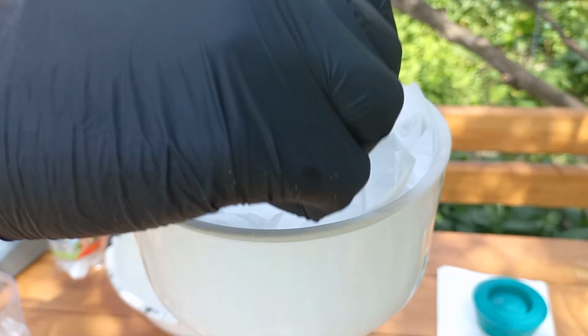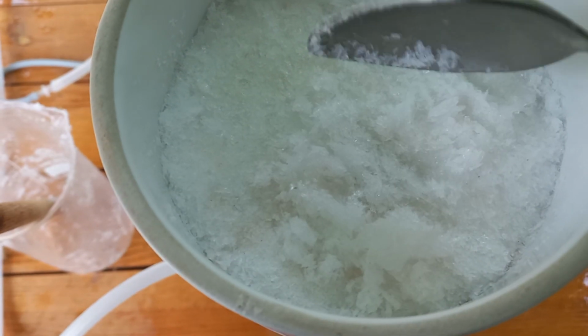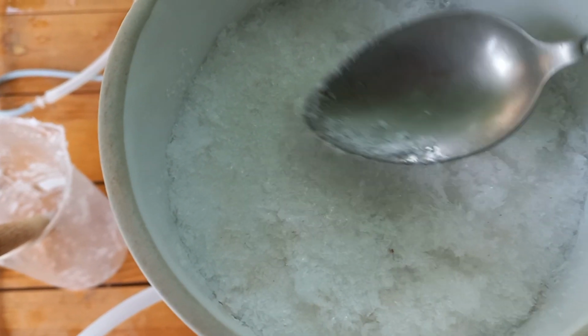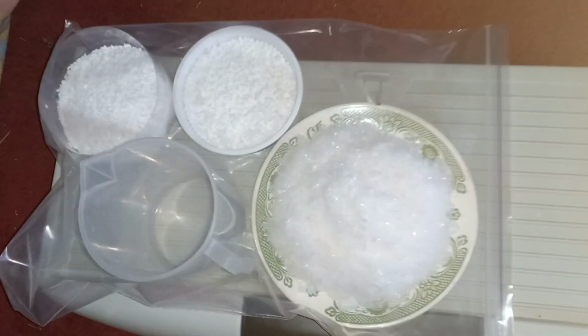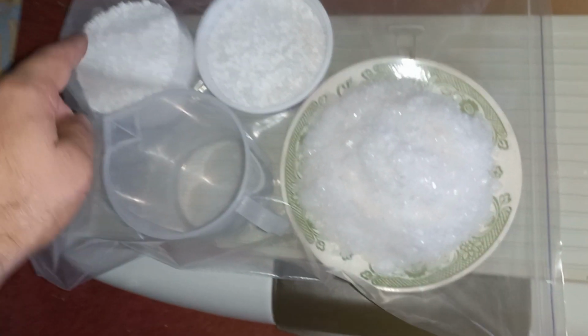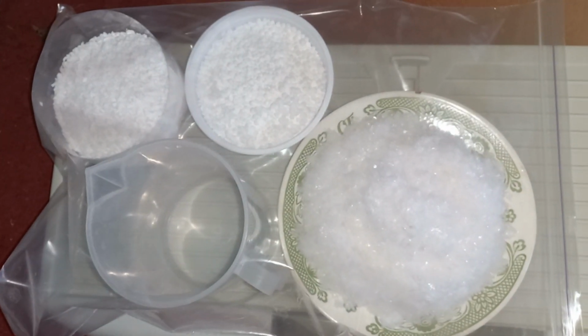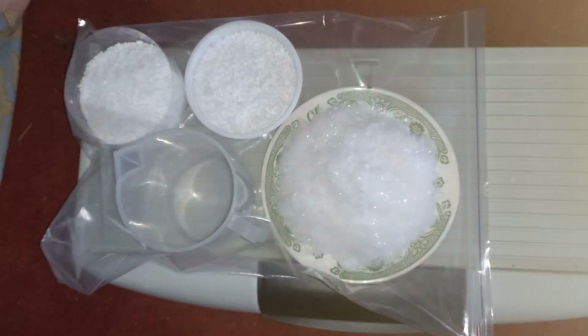Since the dimethyl oxalate sublimates at room temperature, I recommend drying it in a desiccator bag for 1-2 days with calcium chloride to remove all the water. This is my version of desiccator bag. Here is my wet dimethyl oxalate, and here is calcium chloride. Avoid using sodium or potassium hydroxides as desiccants because they react with dimethyl oxalate.